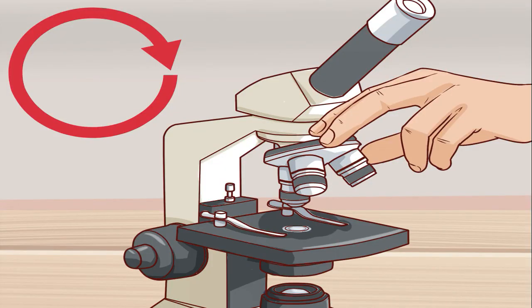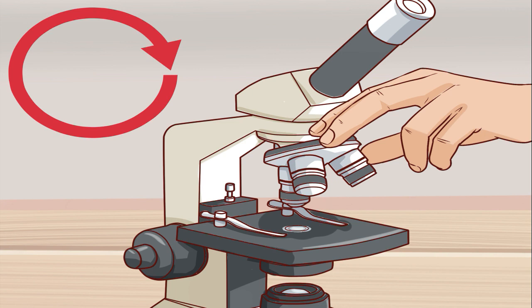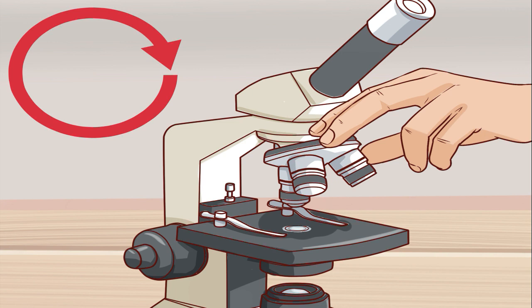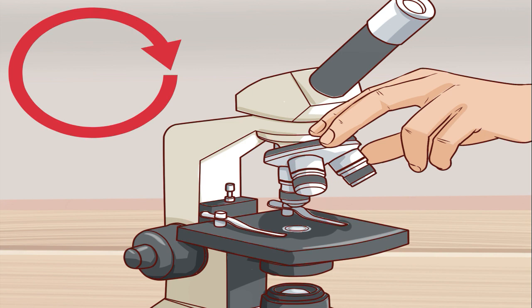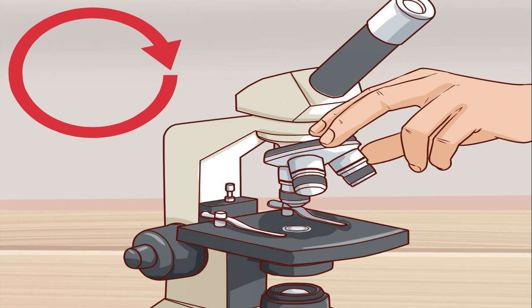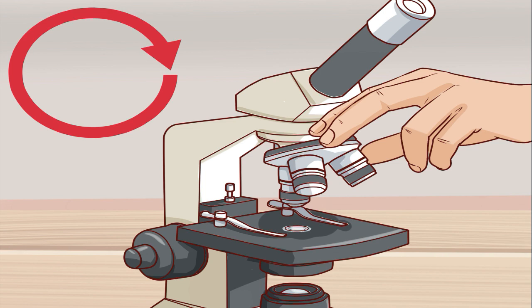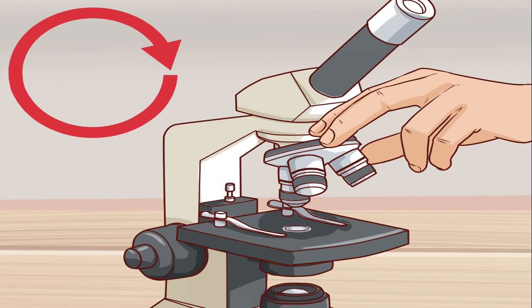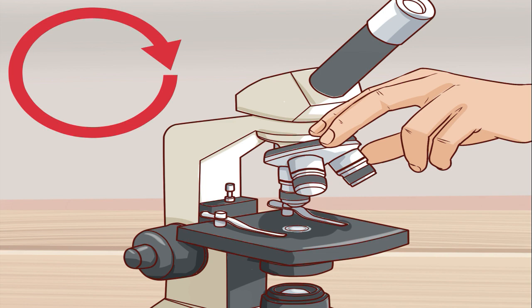Change the objective lens from low to medium or high power. Be sure that the objective lenses do not hit the stage when you rotate them into place, as this could scratch the fragile lenses or break the slide.